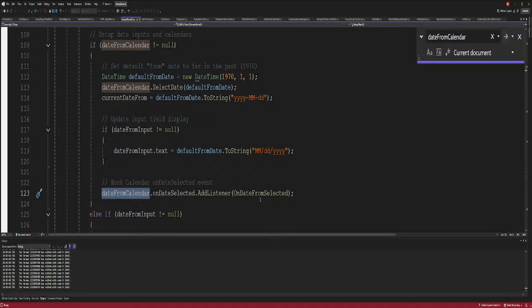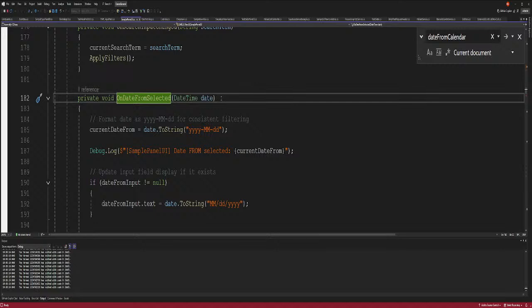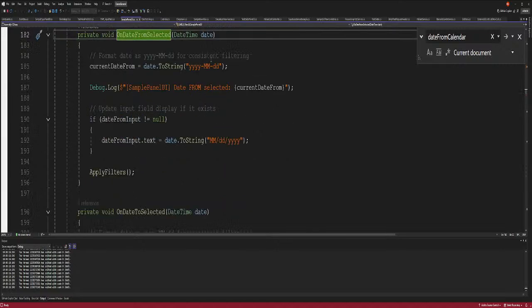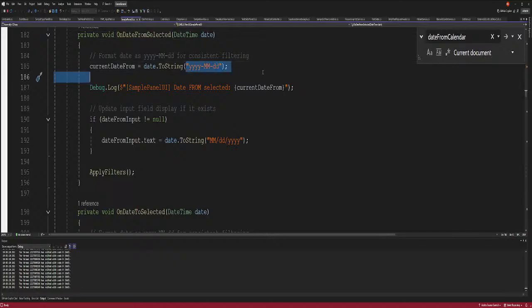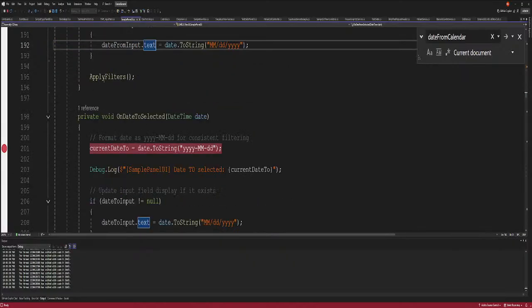We add a listener to the default date, and remember the listener's parameters have to be the same as the one that's going to listen. So we are listening for the date and time. Once we get the date and time, we make sure that we have the right format, which I got wrong last time. And then we assign that to the text, and then we apply the filter, right?